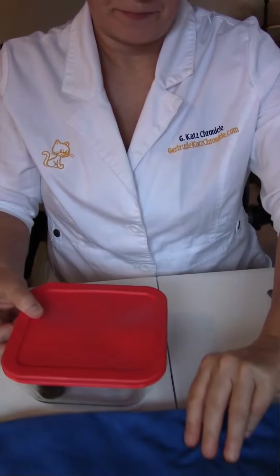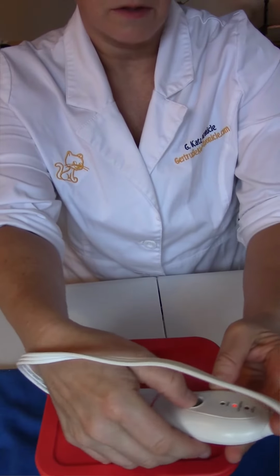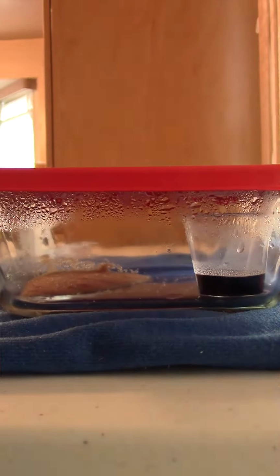In the summertime, it may be enough heat outside. Cold weather and you've got radiators, you can put it on a radiator. For this activity, I use a heating pad. Sometimes it takes a little bit longer, but over the course of the period, or you can show students the next day the reaction. It looks like a reaction did happen.